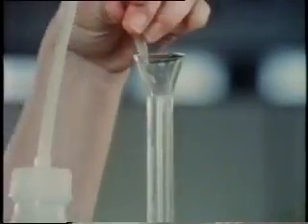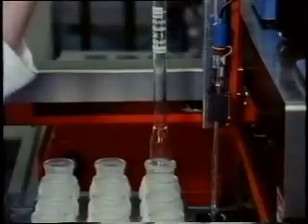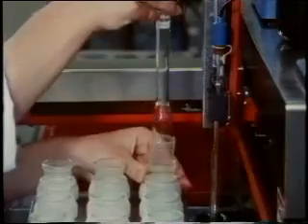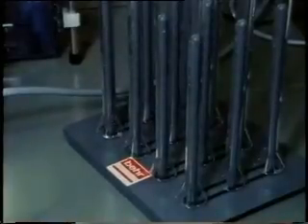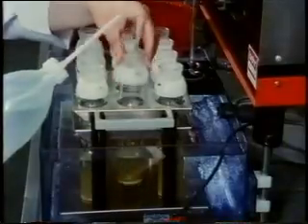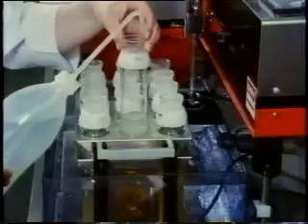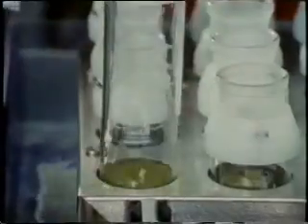After the reaction mixture has cooled down to below a temperature of about 60 degrees, the cooler funnel is flushed with water. The contents of the reaction vessel are diluted with high purity water to at least 100 millilitres and allowed to cool to room temperature.